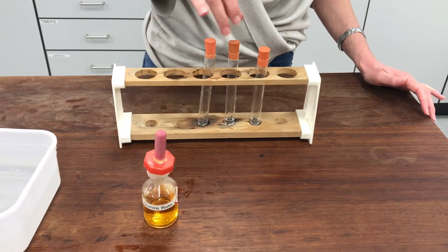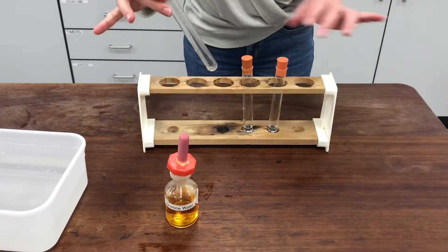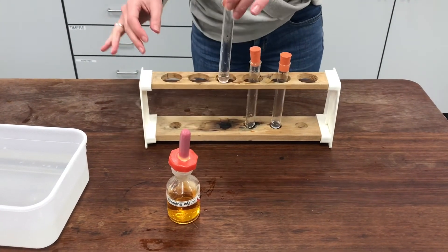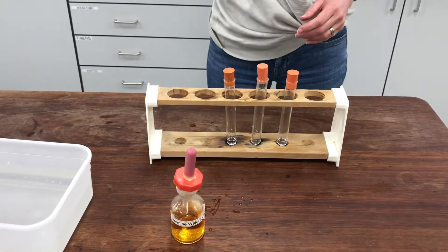I'm going to try now igniting one of the tubes. Let's go with that one that's got the least amount of water in it. And see if it appears that the gas that I've made will burn.